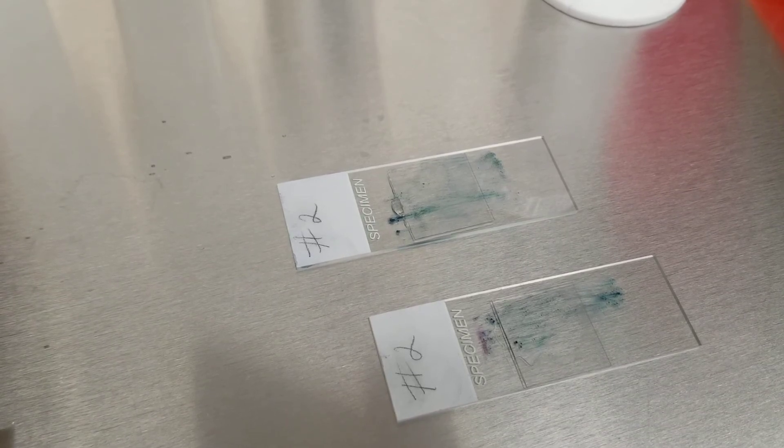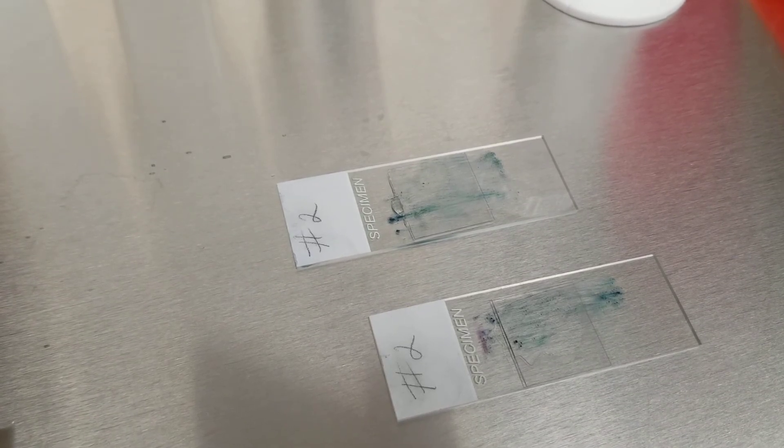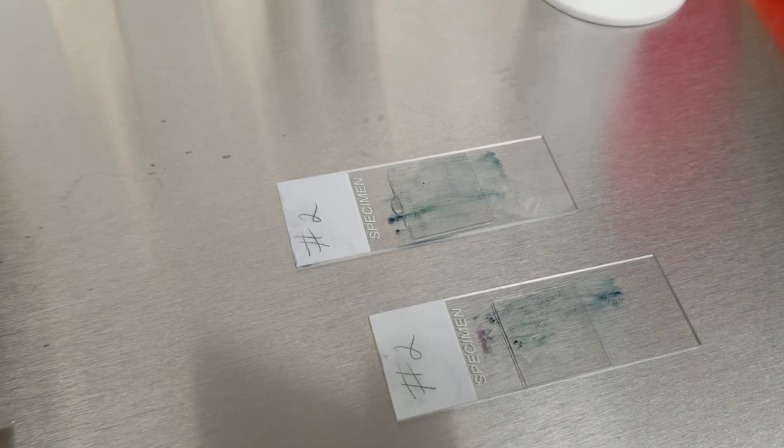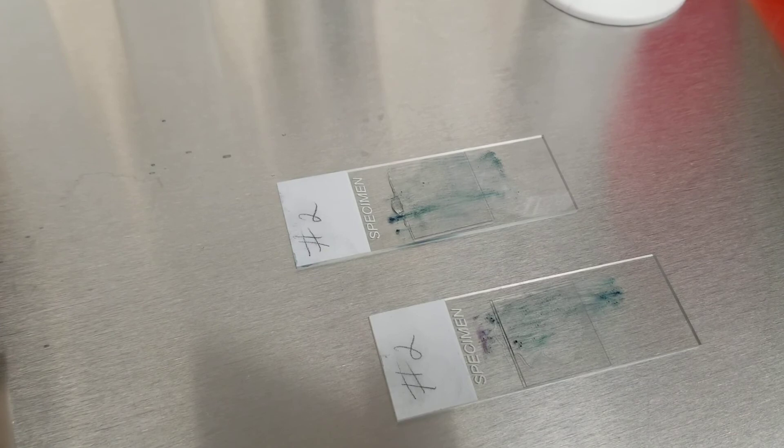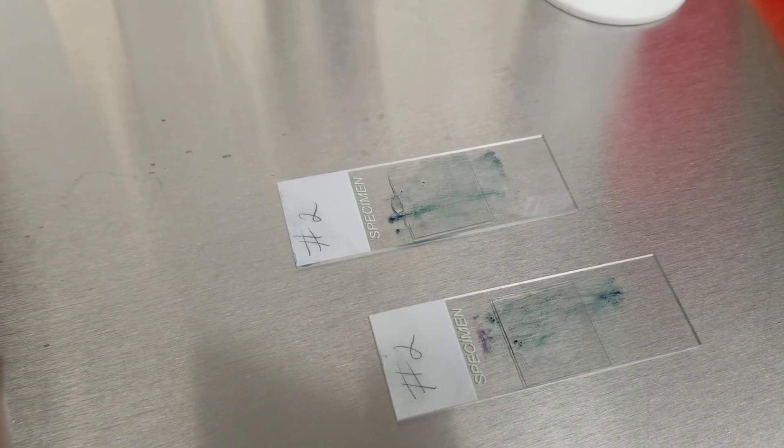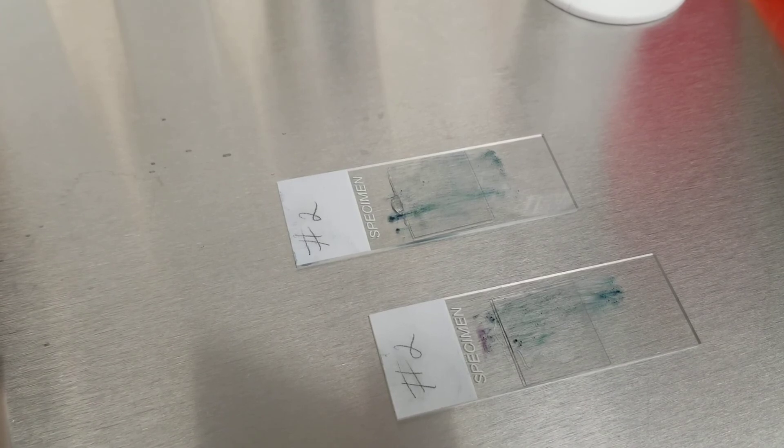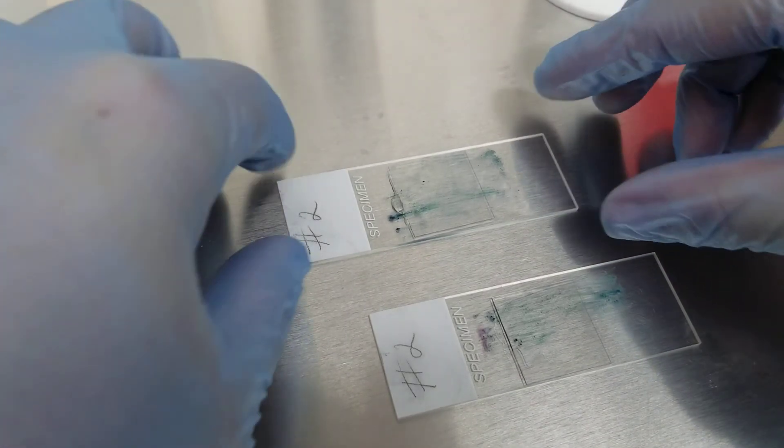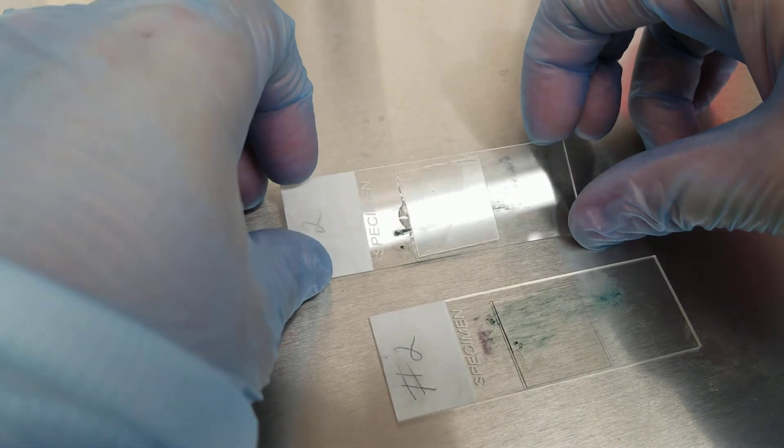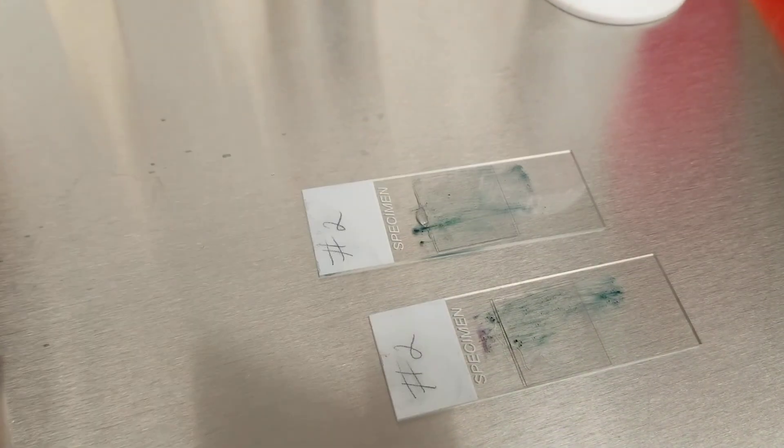It's the same thing if you're doing any type of slide for a permanent record, making sure that it's coverslipped and that it can be under oil immersion anytime. And you can then wipe and clean the oil off afterwards.